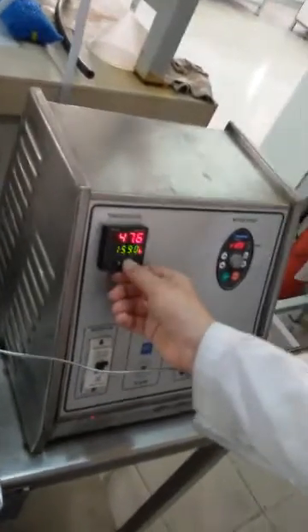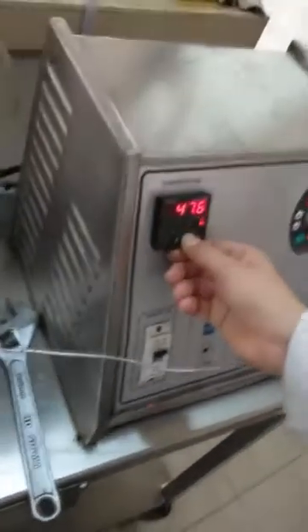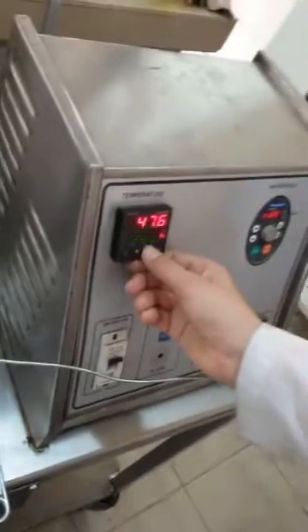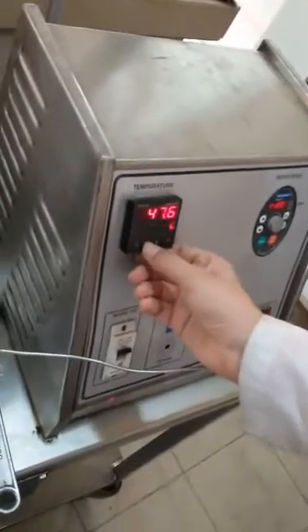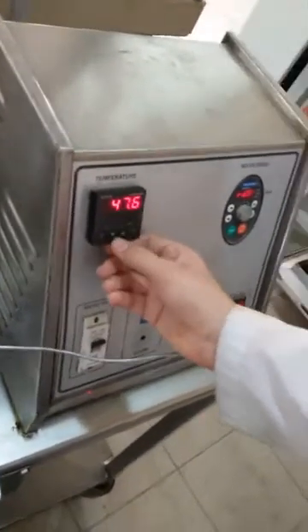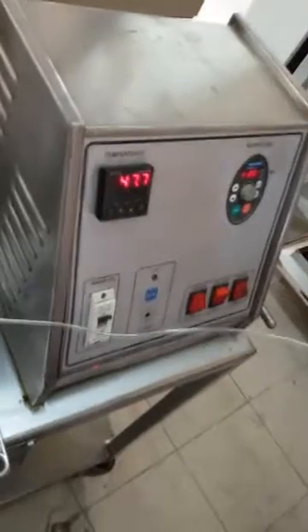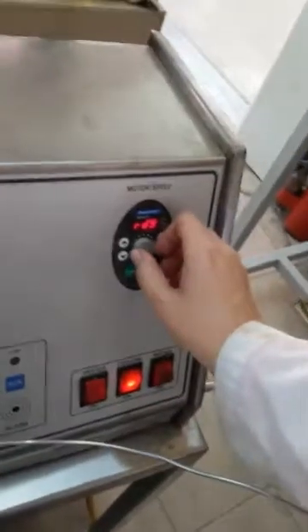I have it set like that. You can turn it up or down if you want. This is the value I want for my own experiment. This you can adjust.